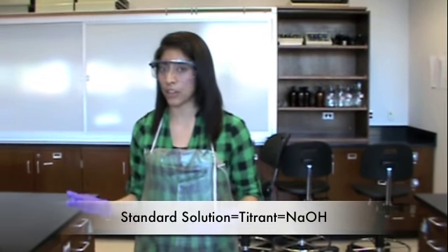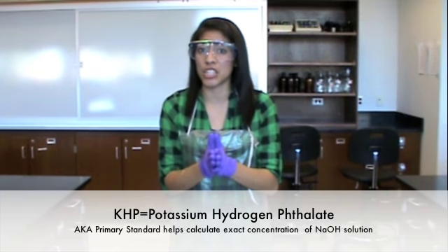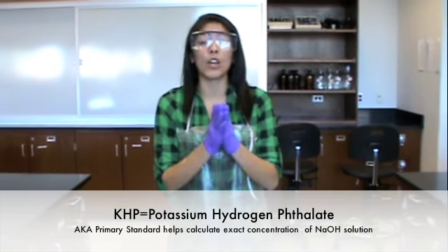Our standard solution, which is our titrant, NaOH, is just a solution that we know the concentration of. We have it reacting to KHP as well as vinegar solution. So the first part involves standardizing NaOH, which is when NaOH completely reacts with KHP. Therefore, when the titration is complete, it is known as your equivalence point. And this is found through a color change.